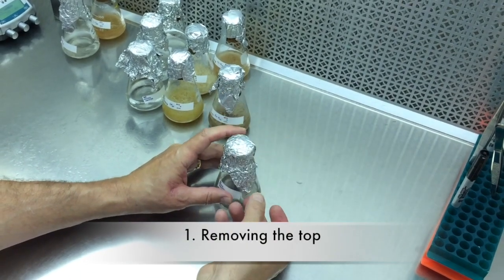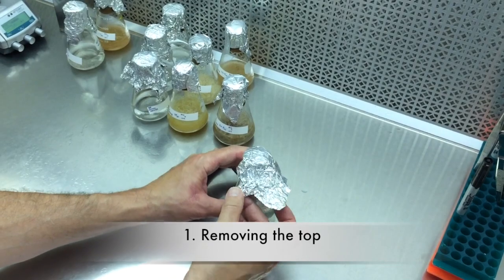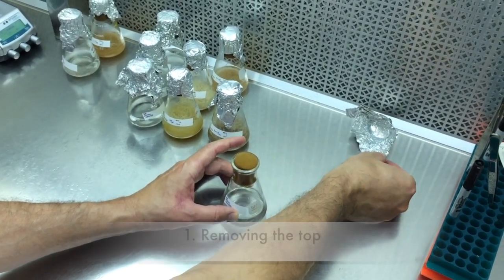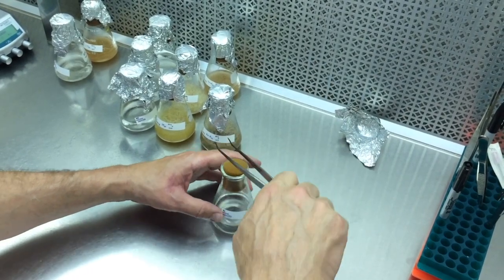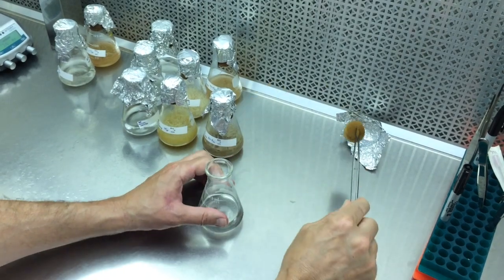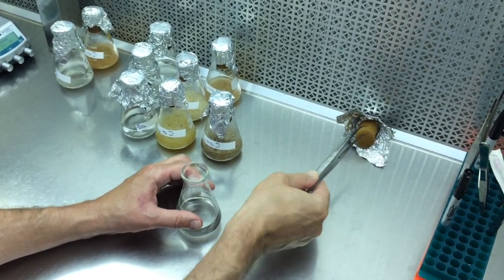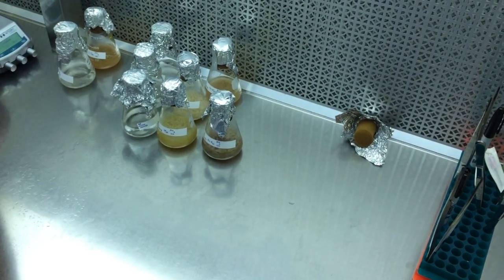You don't peel it up like this, you kind of pull out on it. And what it does is it kind of opens it up based on the things that are there. And that gives it a nice stable thing to kind of sit in the hood, as well as a place to grab here along the edge, turn it as you twist, and then a sterile place to set down the actual stopper. Flash it.